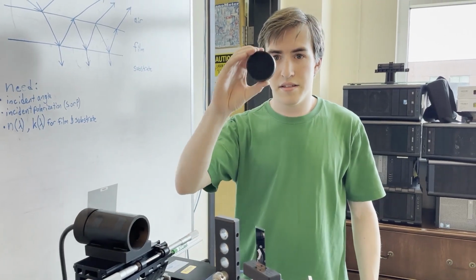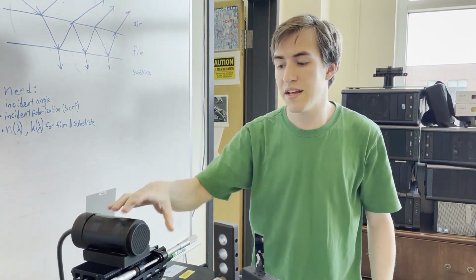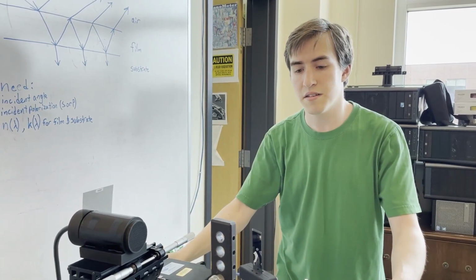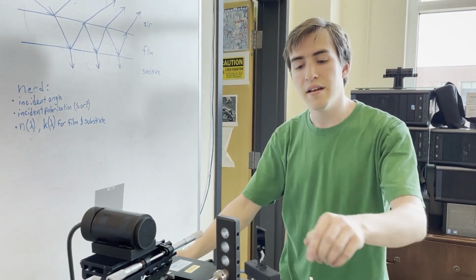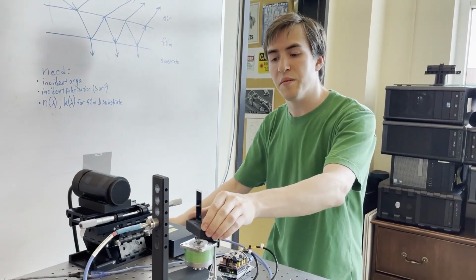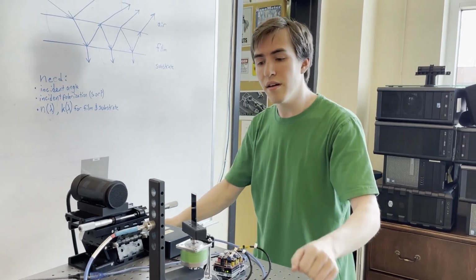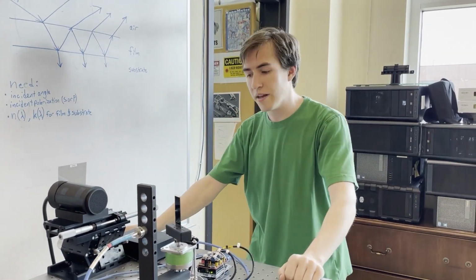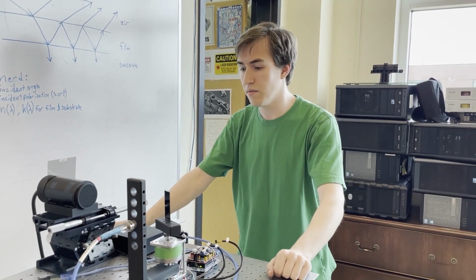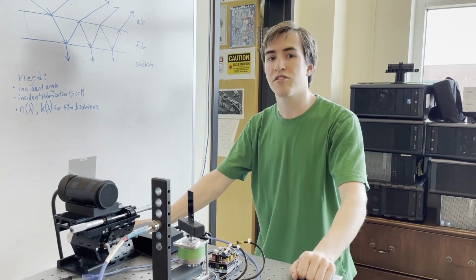After that is this collimator, which has the added benefit of attenuating the amount of light that hits the spectrometer. Turns out our source is too bright even on the lowest setting. Next, the light will hit the sample to be measured, or the reference sample as what's installed right now. And finally, that goes into this fiber optic cable, which goes to the spectrum analyzer, and well, that's all of the hardware. Next is the software and how to actually use this setup.